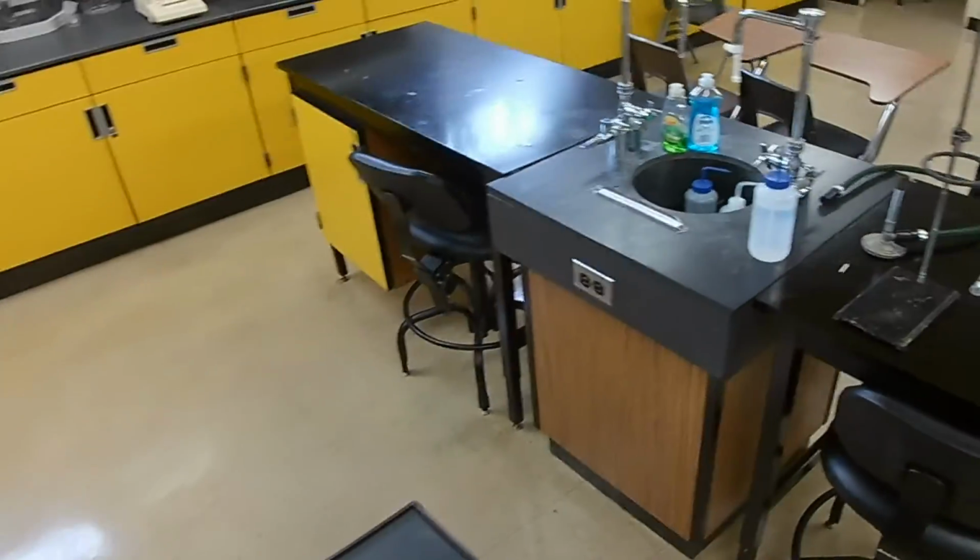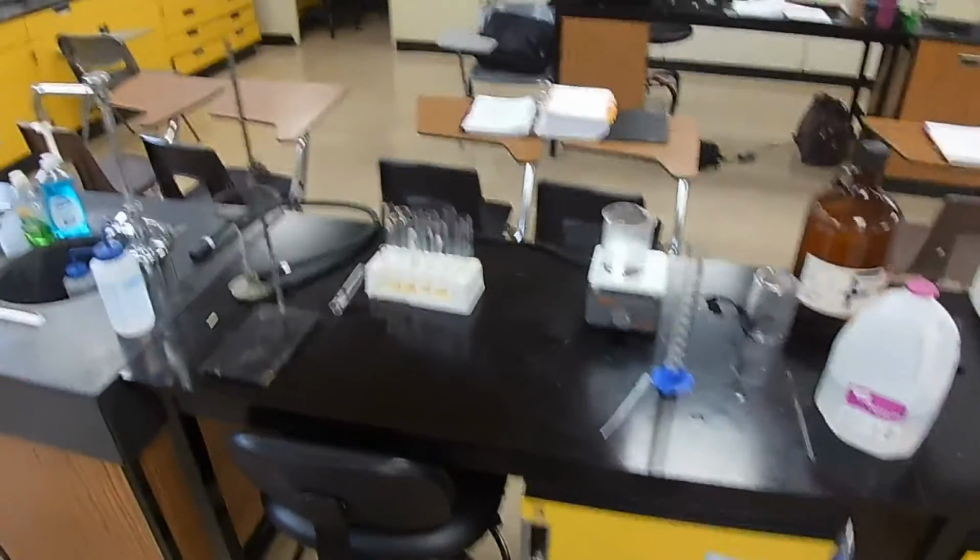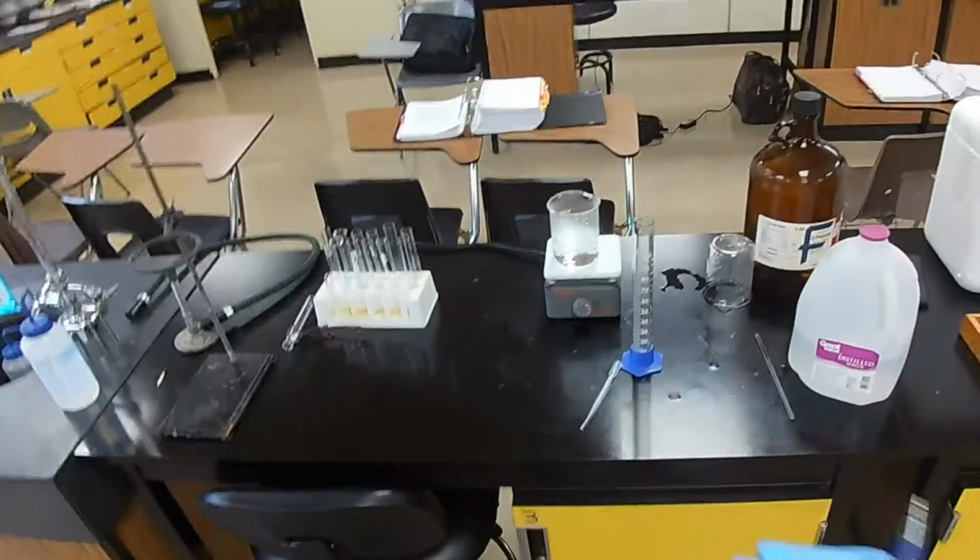Were the volume measurements you made using the 10 milliliter graduated cylinder more or less or equally precise as the volume measurements you made using the 100 milliliter graduated cylinder? That's simply looking at the cylinders and seeing what's the finest possible measurement that can be made with either.